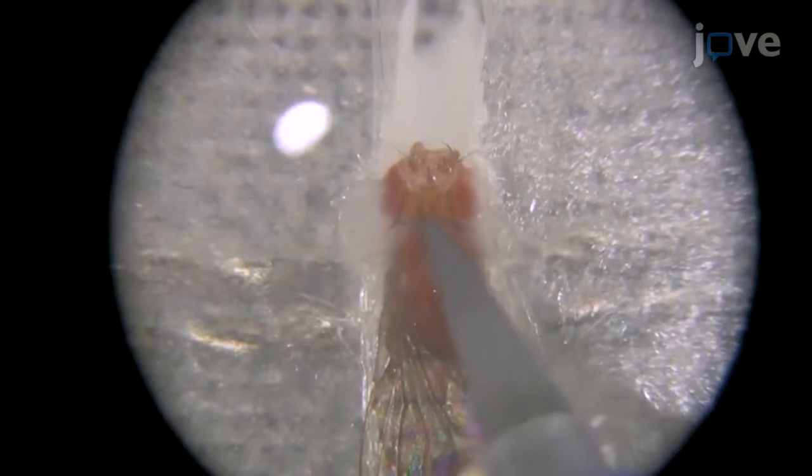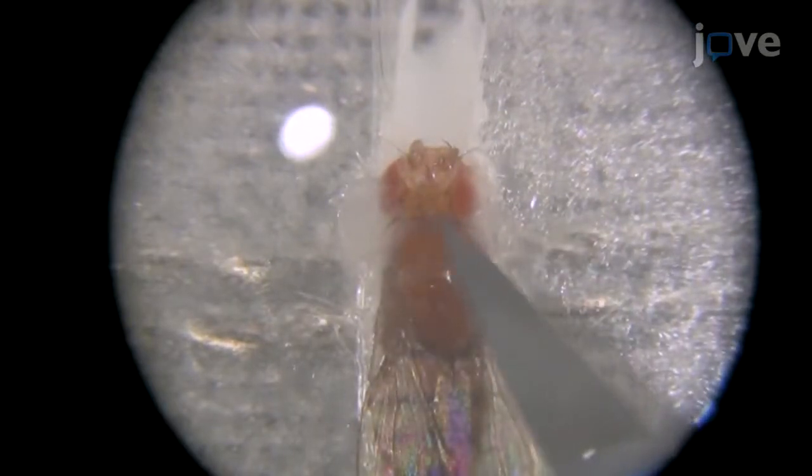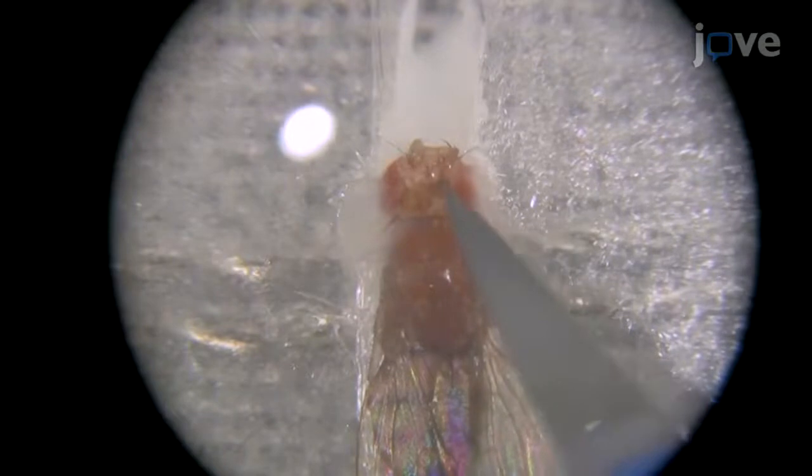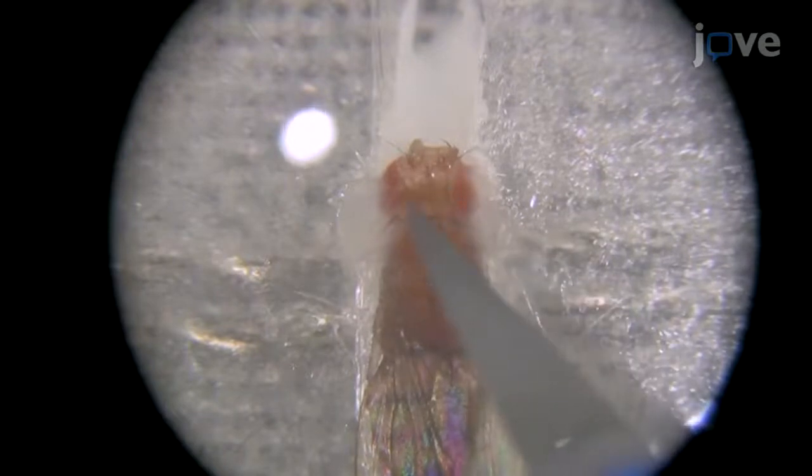Using a very fine bladed stab knife, cut through the cuticle across the posterior of the head, starting at the ocelli and cutting up each side, medial to the eyes, to form a flap of the cuticle that can be easily torn off using forceps.